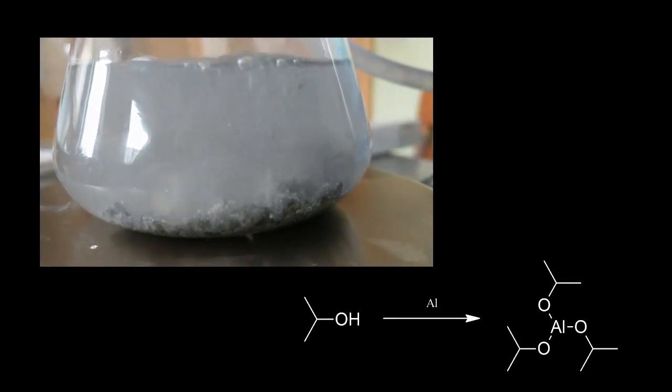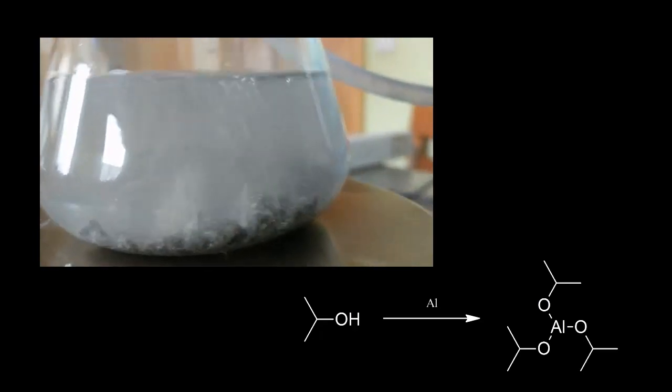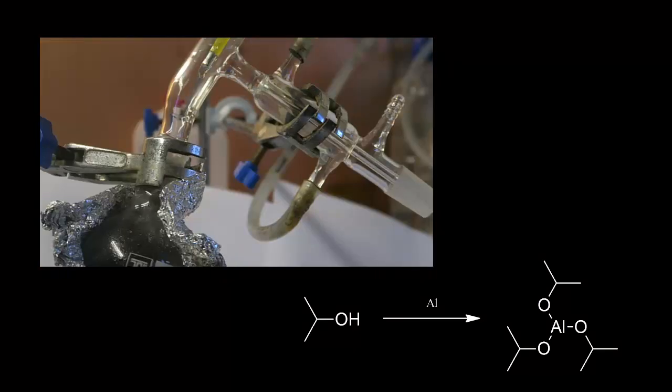After 6 hours I started distilling the aluminum isopropoxide. Because of its high boiling point, it's recommended to use a short path distillation apparatus.